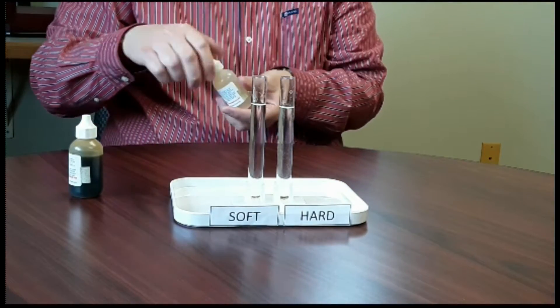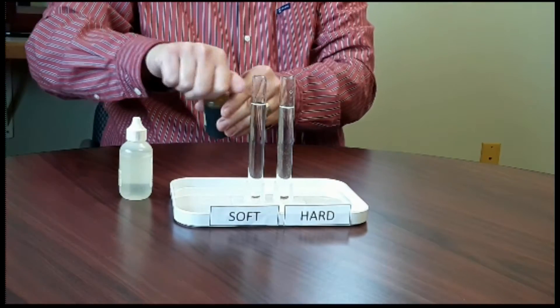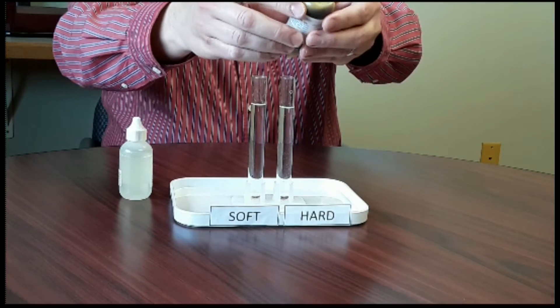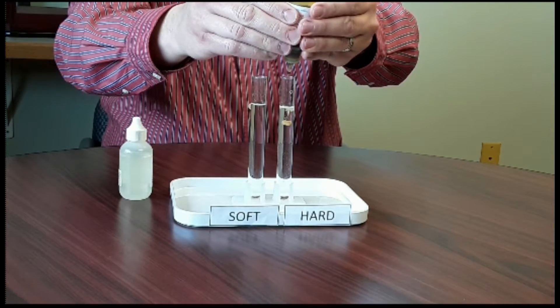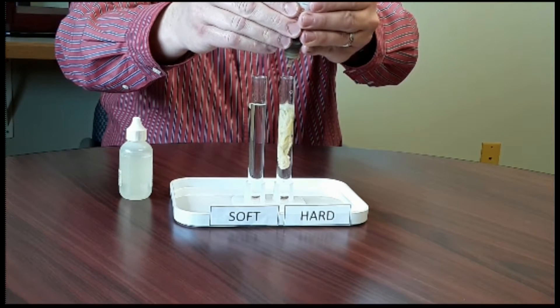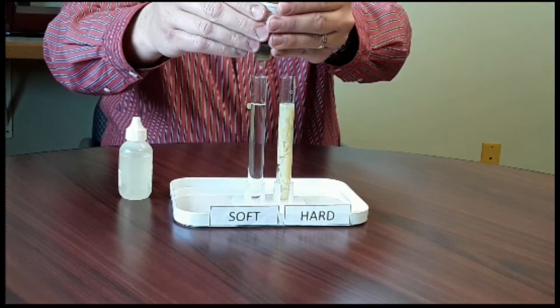Then we're going to move to the second solution and add 10 drops to the hard water vial, and 10 drops to the soft water vial.